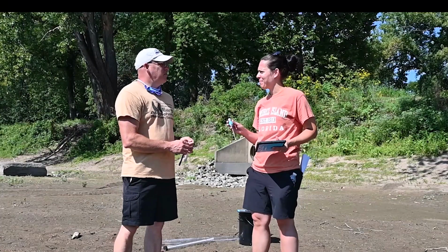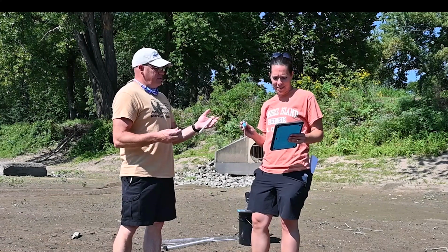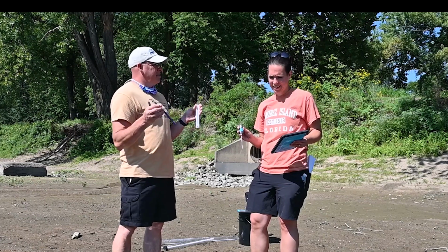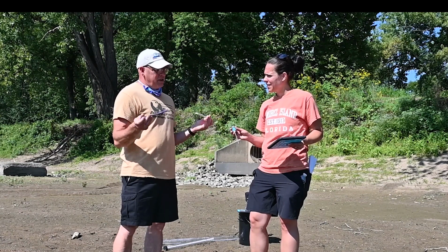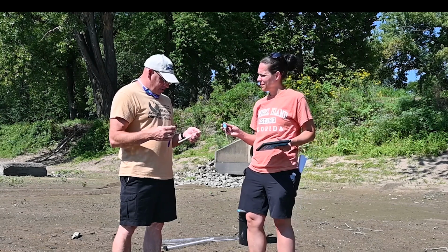Okay, Sarah. We put away our other instruments, and we got our thermometers. I know you have one of the Vernier probe thermometers in the iPad, but I brought these thermometers. Nice. Because I figured a thermometer's a thermometer, it won't matter, right? That's exactly right. Any thermometer should work.